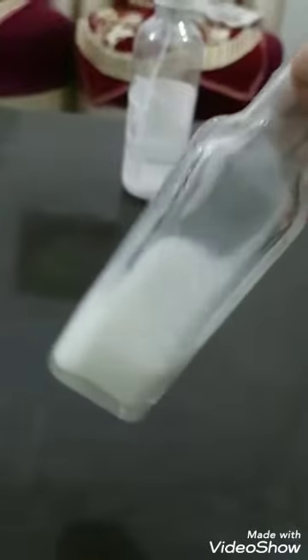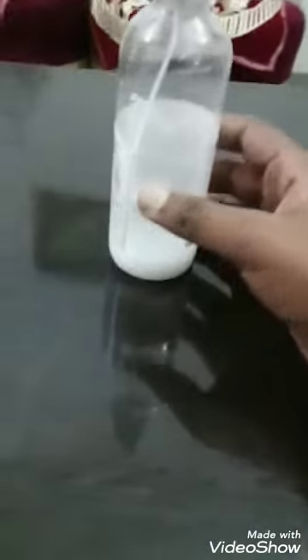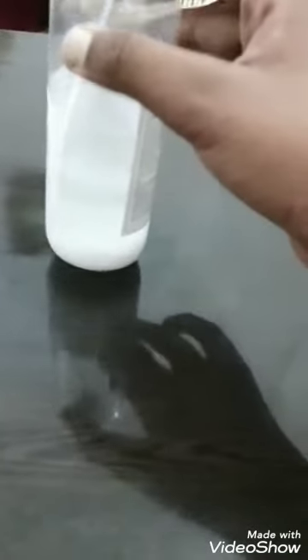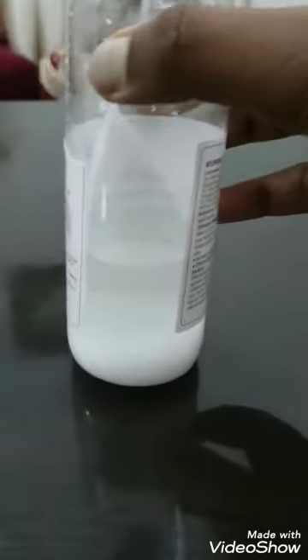You should end up with something looking like this. If you're going with the sedimentation method of adding 10 milliliters of ethanol to the solution, it should look like this. You can clearly see really crystal clear water at the top and that aluminum hydroxide settling at the bottom.